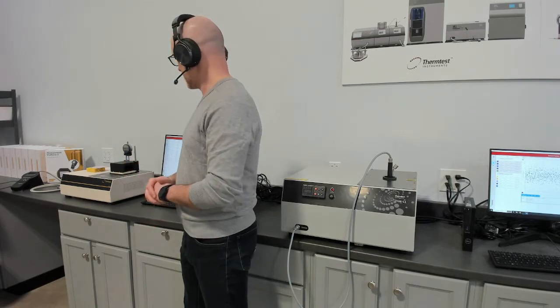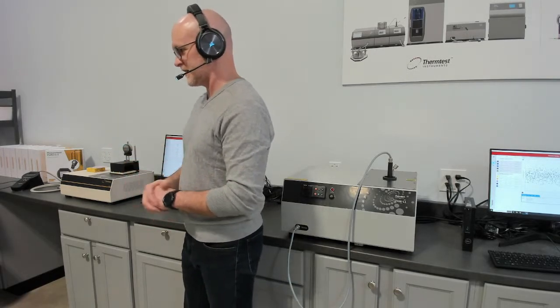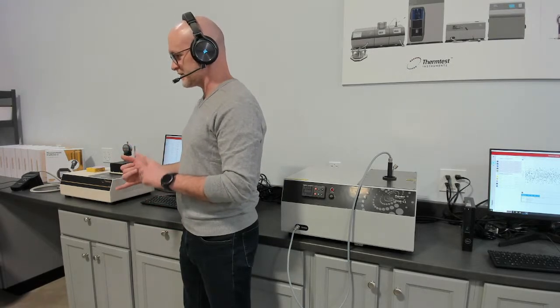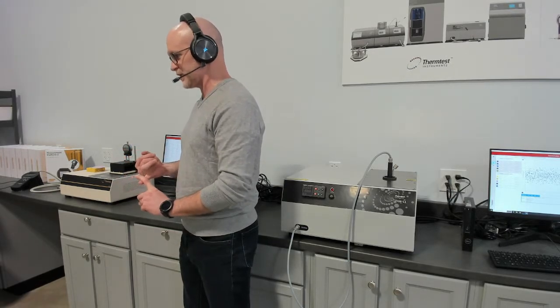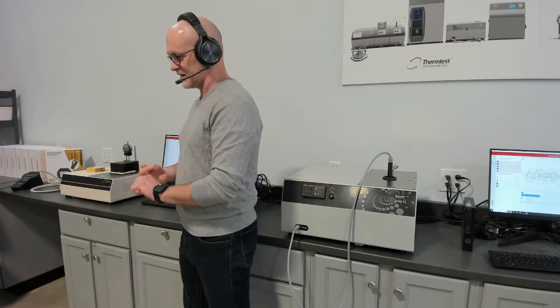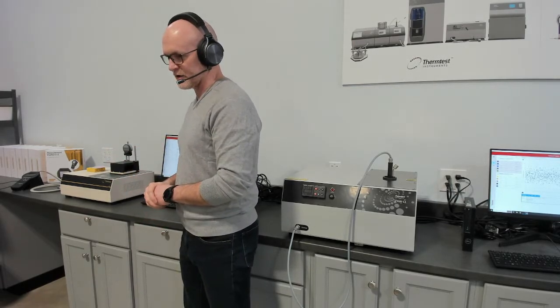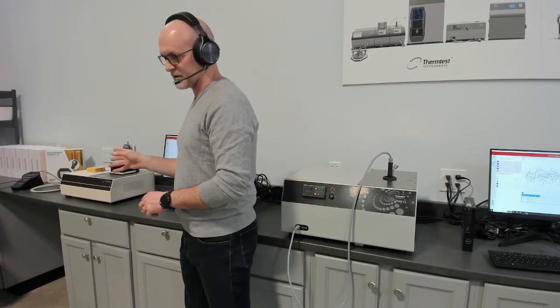meter method. And down the other end is the baby brother to the MP-1, which is our MP-2, which has primary sensors for measuring solids, liquids, so transient plane source, transient hot wire, and transient line source. They have more narrow ranges, but the unit is quite accurate and economical.